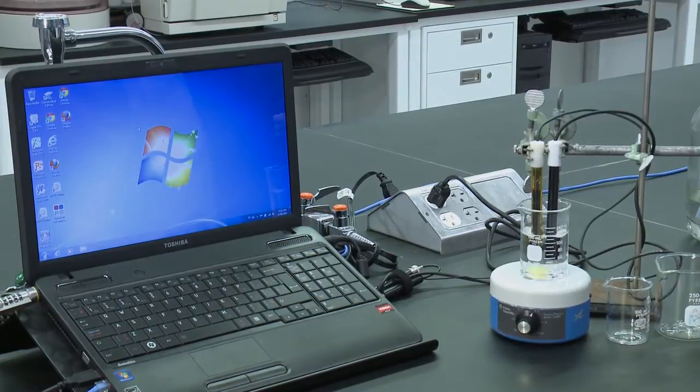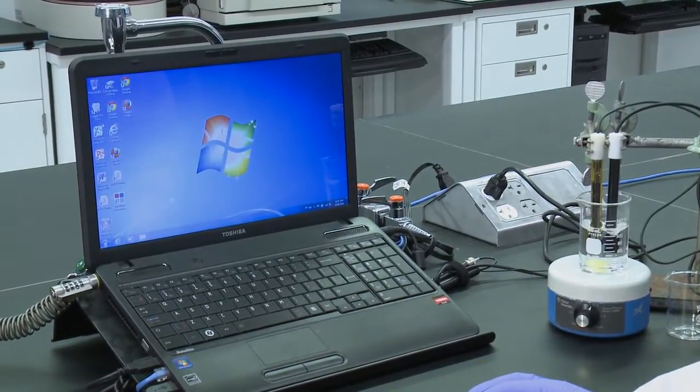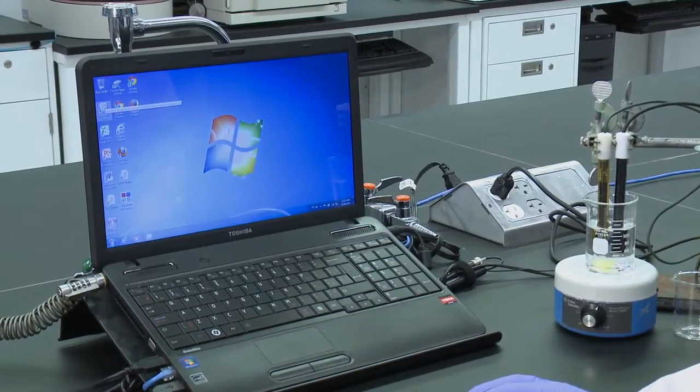At this point, you're ready to start taking measurements. On the desktop, you'll want to open the Logger Pro icon.